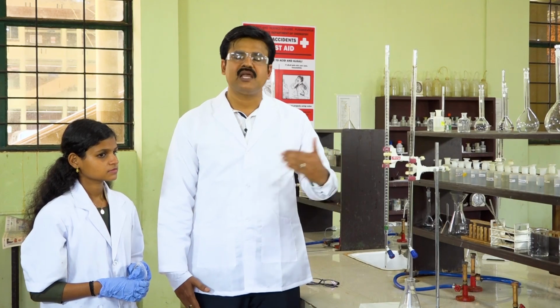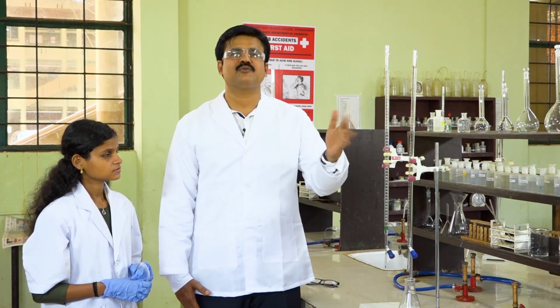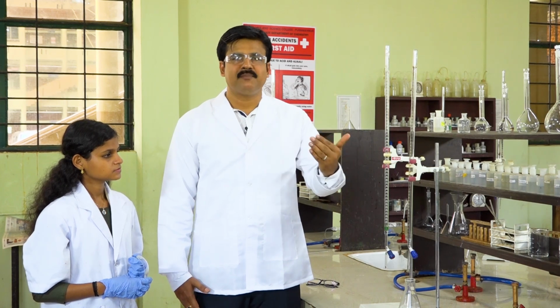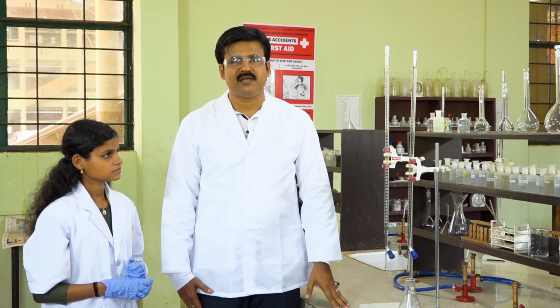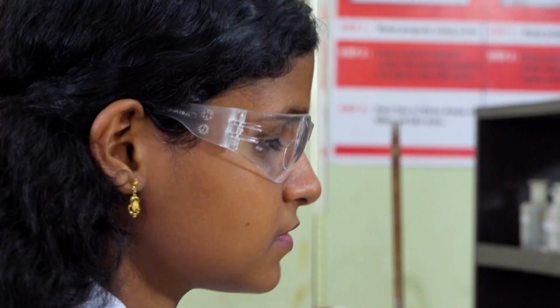Again add 2 more ml of sodium carbonate and repeat the same process. The entire process is repeated by adding 2 ml of sodium carbonate in each titration up to a total volume of 24 ml. In each case, we have to record the titer value of hydrochloric acid. We can calculate the normality of the solution from the formula N1V1 = N2V2. You can also calculate the final value of normality of the unknown solution by the graphical method.